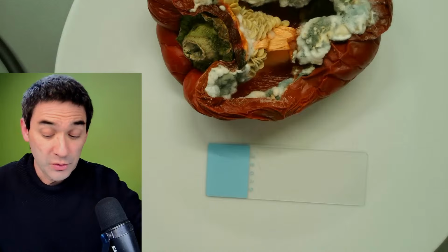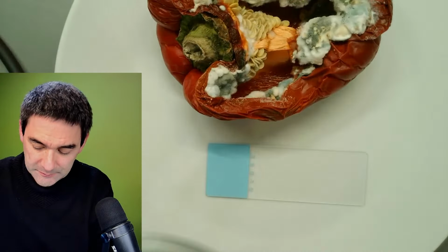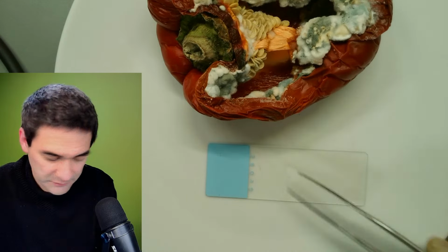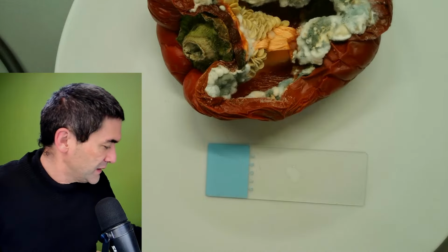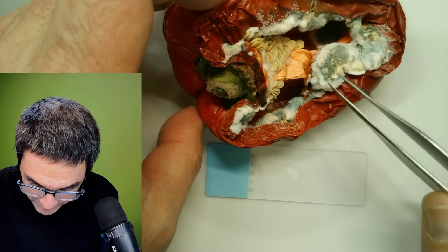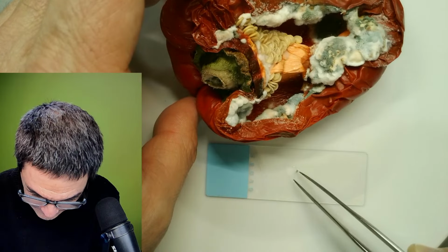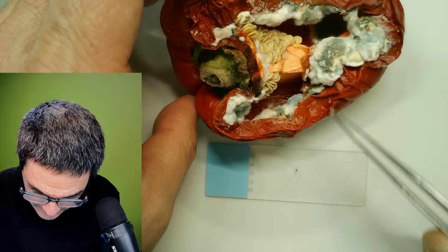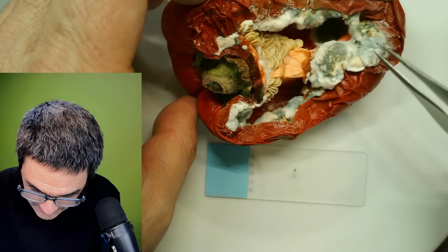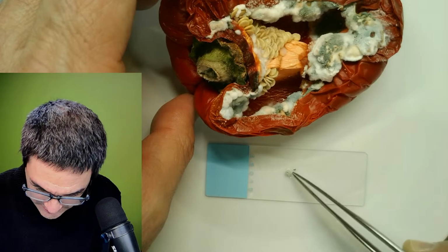So I just want to look at this because I have not looked at it yet, right? That's the only thing. A little bit of water here. And I need my glasses. And I don't know, there are so many different, probably different fungi over here. There's this gray stuff here, which I assume are fruiting bodies. And there's this other, more or less interesting thing, and this is way too large.